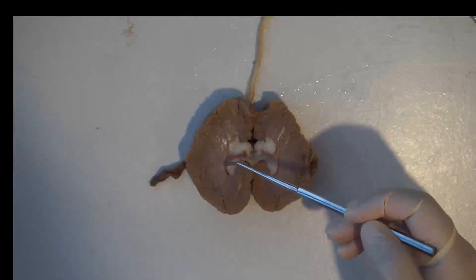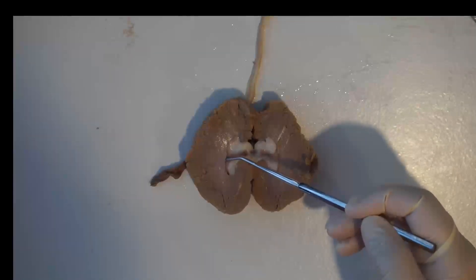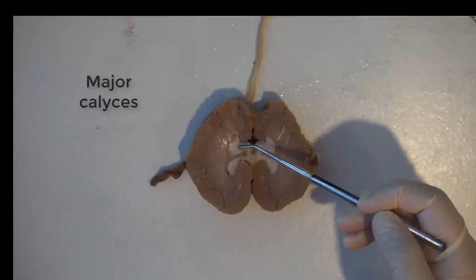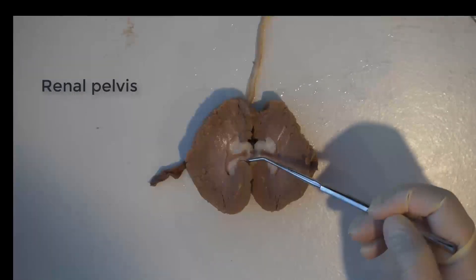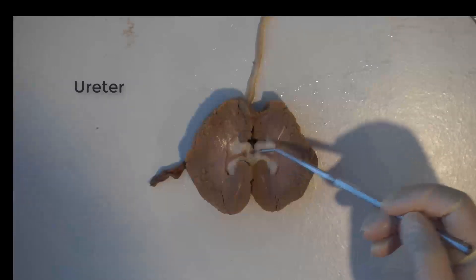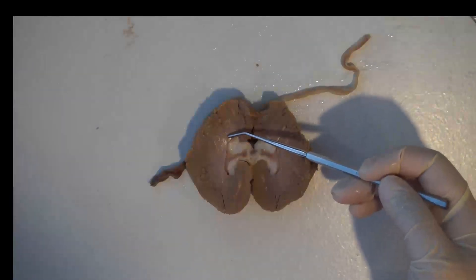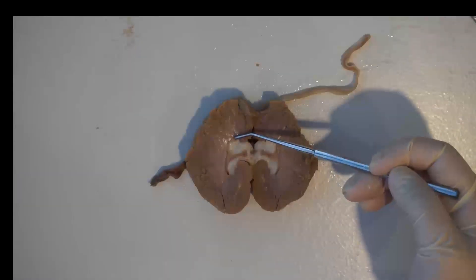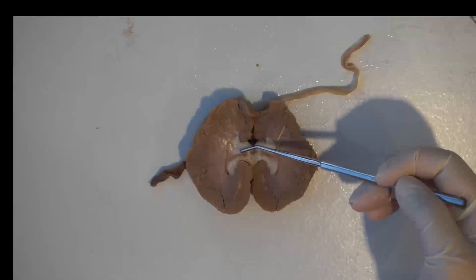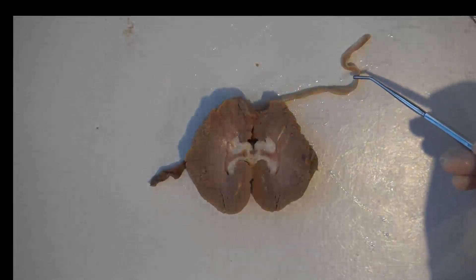The urine produced in the renal pyramids flows into the minor calyces, then into the major calyces, and then into the renal pelvis, before flowing out through the ureter and down to the urinary bladder. To recap: urine comes from the renal pyramids and the nephrons located between the renal pyramids and the cortex, into the minor calyces, major calyces, renal pelvis, and then out through the ureter down to the bladder.